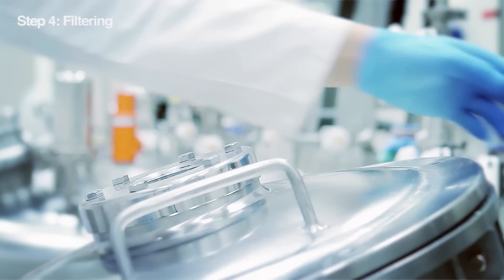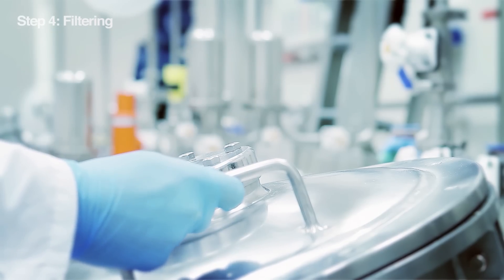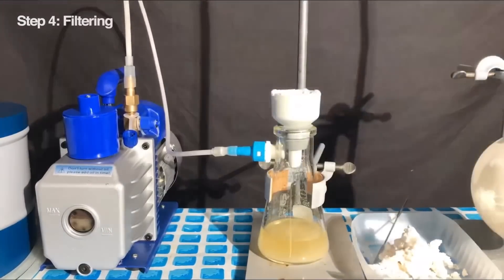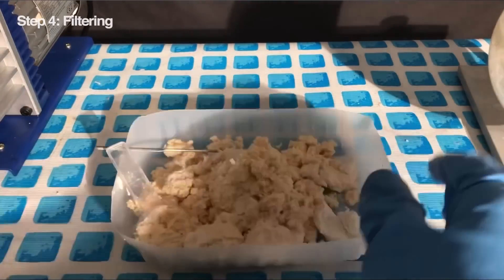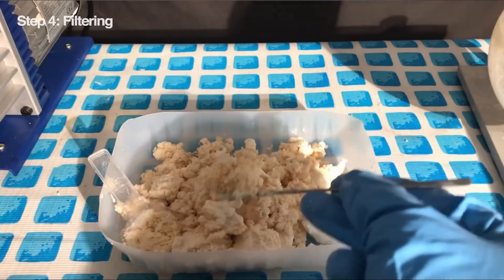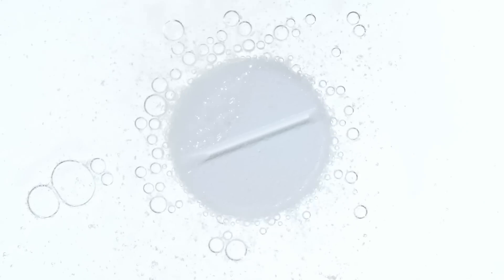First, our aspirin — a soup of crystals and ethanol — gets transferred to a big tank with a built-in stirrer. This keeps all the crystals nicely and evenly suspended in the liquid. Then the whole mixture gets pumped into the filter. Inside, the liquid gets separated from the solids. Pure aspirin crystals are left behind on the filter while the leftover ethanol is collected separately. We're getting closer and closer to that final, perfect aspirin.